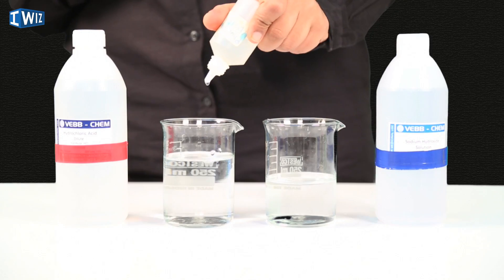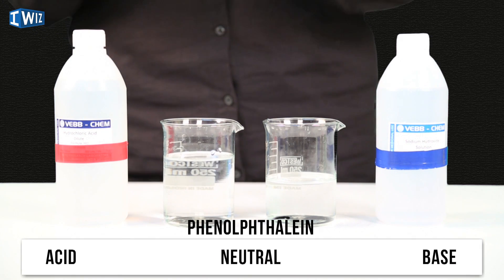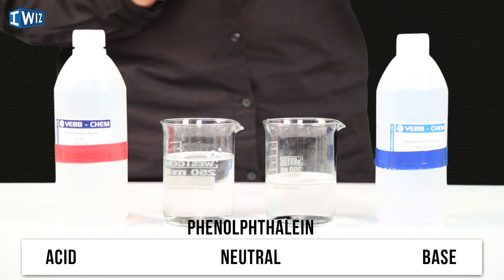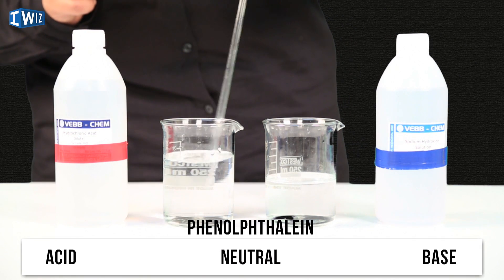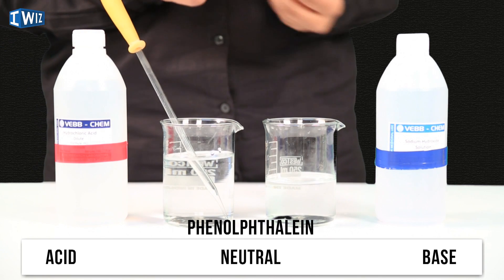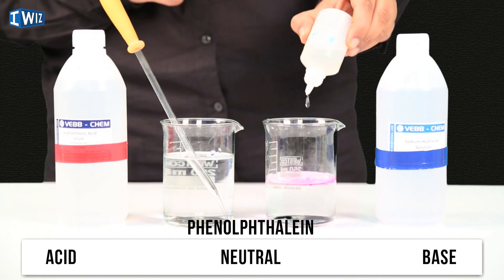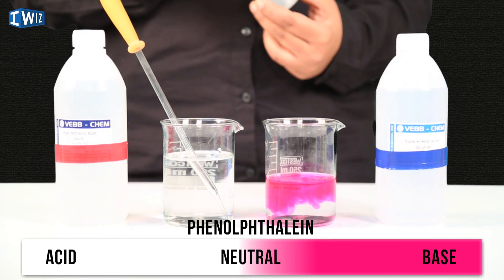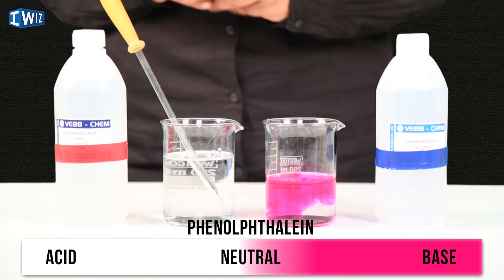The next indicator we have is phenolphthalein. Let's pour it into an acidic solution — we observe no color change. Now let's put it in a basic solution — you can see it turns a hot pink.